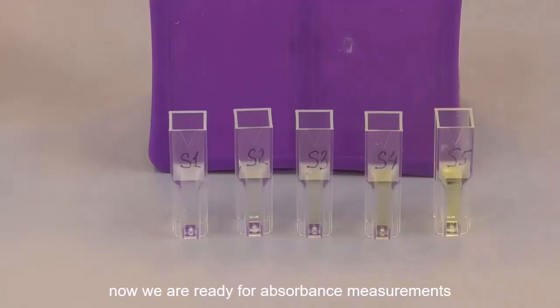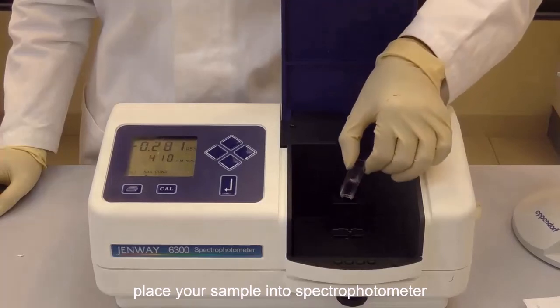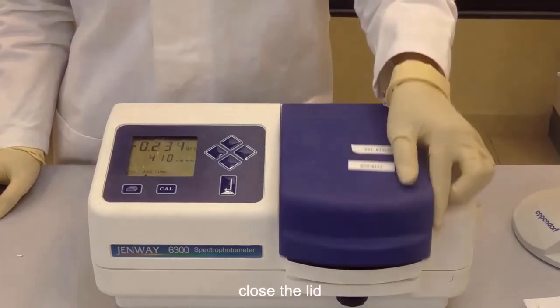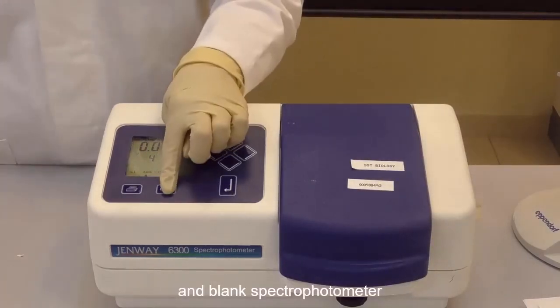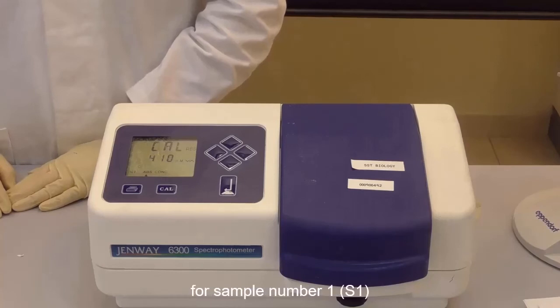Now we are ready for absorbance measurements, and the spectrophotometer is an instrument that allows us to measure absorbance. Place your sample into the spectrophotometer, close the lid, and blank the spectrophotometer by pressing on the calibration button. This would mean that we set it to 0 for sample number 1.